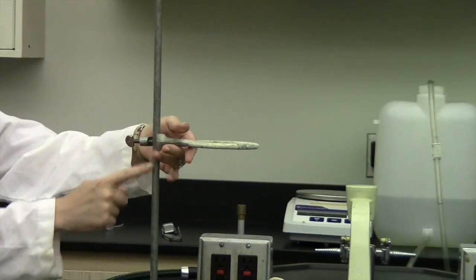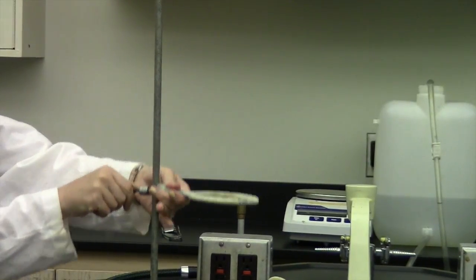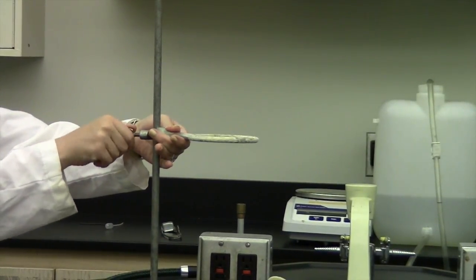Now you can adjust this height so all you have to do is just loosen it and then move it down. You can adjust it as high or low as you want.